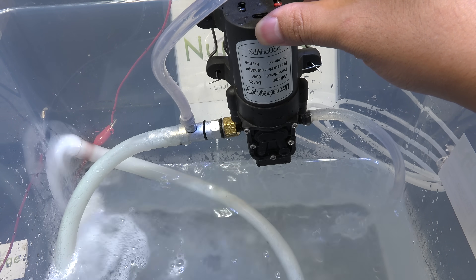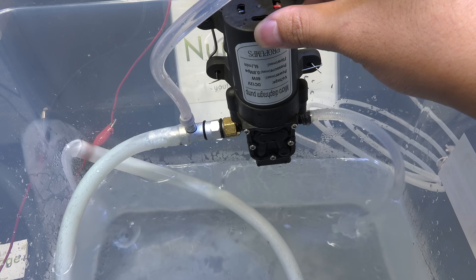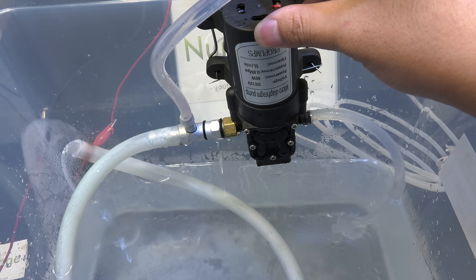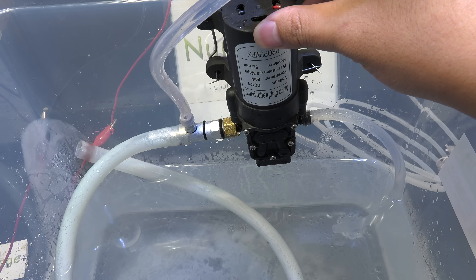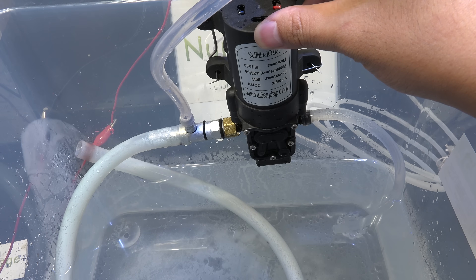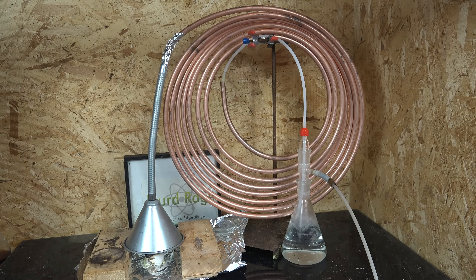A special note if you're using the aspirator pump setup: you'll need to put your vacuum pump outside or in a fume hood, as a small amount of sulfur dioxide will get pulled into the pump and exit out the exhaust. Do not have it in the main workspace of your lab or you'll get gassed with sulfur dioxide. That's how we make and utilize sulfur dioxide from burning sulfur. It's the cheapest source of sulfur dioxide but is somewhat involved since we have to make this gas capture setup to use it.